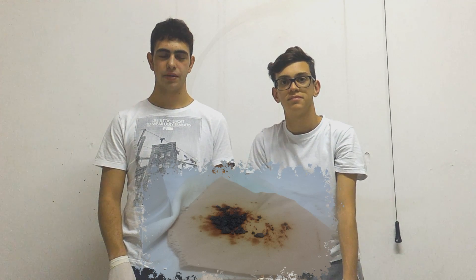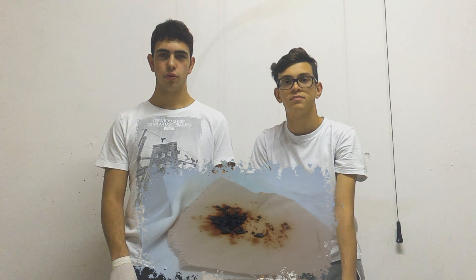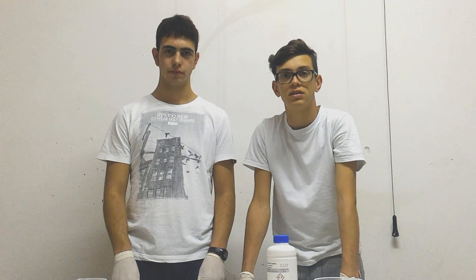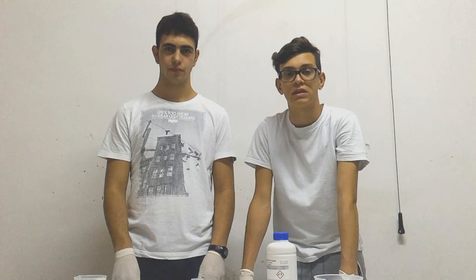Now we have produced some precipitate, but it is still impure, and to purify it we make it sublimate and condensate. We do the sublimation because the two substances have different boiling points, so for this reason we do the sublimation.